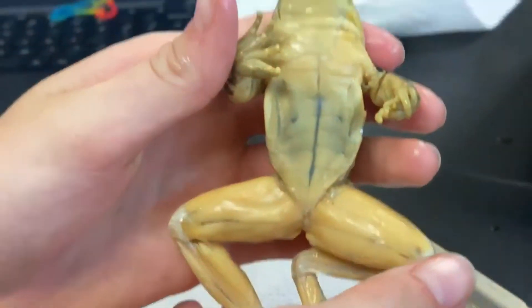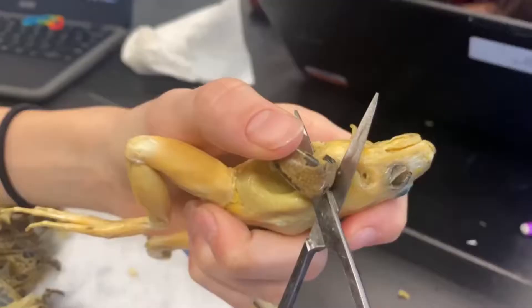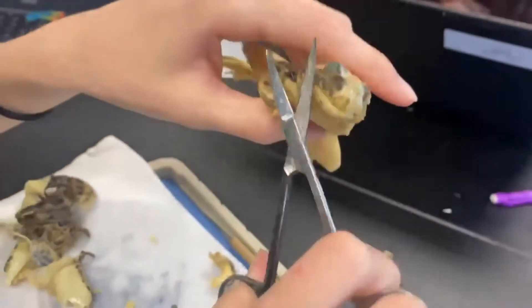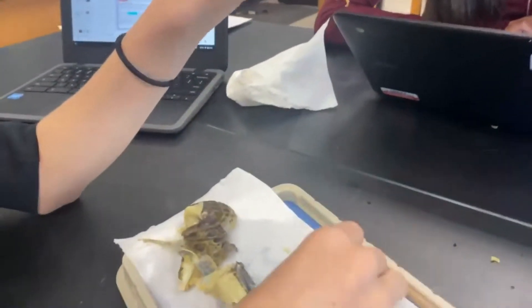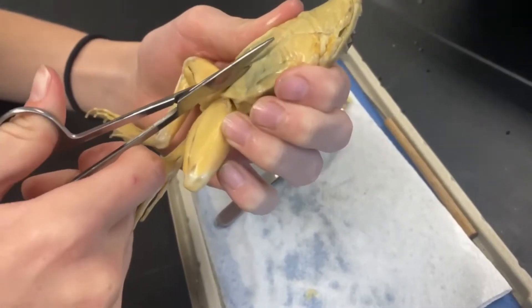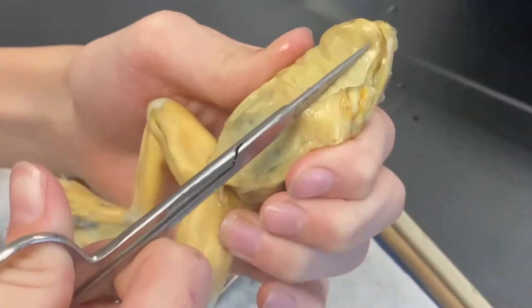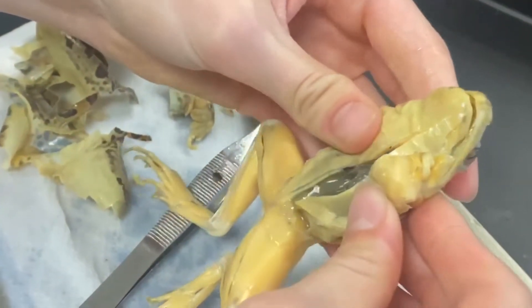My guy's been hitting the gym. Wow. And here's all the skin right here. Cut off the muscle on either side. Ew, it touched me. That's why I'm about to be exposed. We're going to go right over here. Don't cut any of the organs. She's dripping. And now we're going to pop her open.